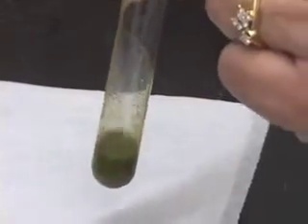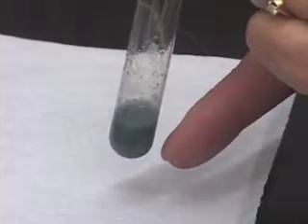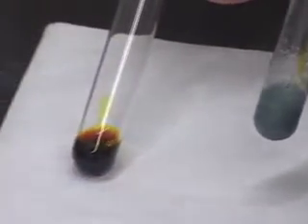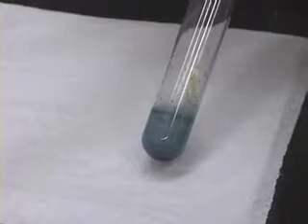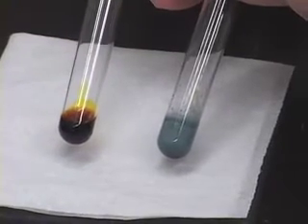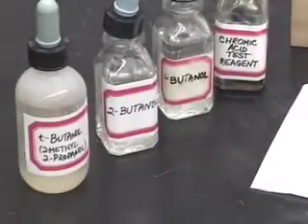Again, notice that we got a blue-green opaque precipitate in this test tube. When chromic acid is treated with 2-butanol, which happens to be a secondary alcohol, the yellow-brown color disappeared giving us a blue-green opaque precipitate. So this also is a positive test result, and we expected 2-butanol to give us a positive test result.